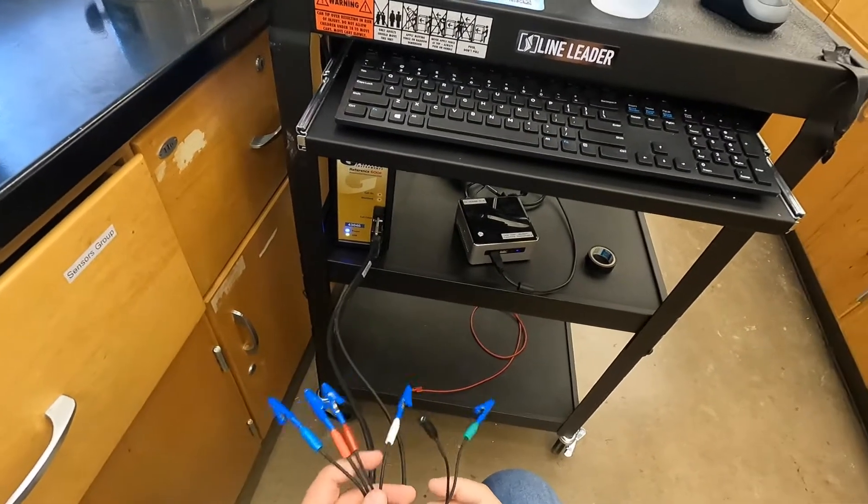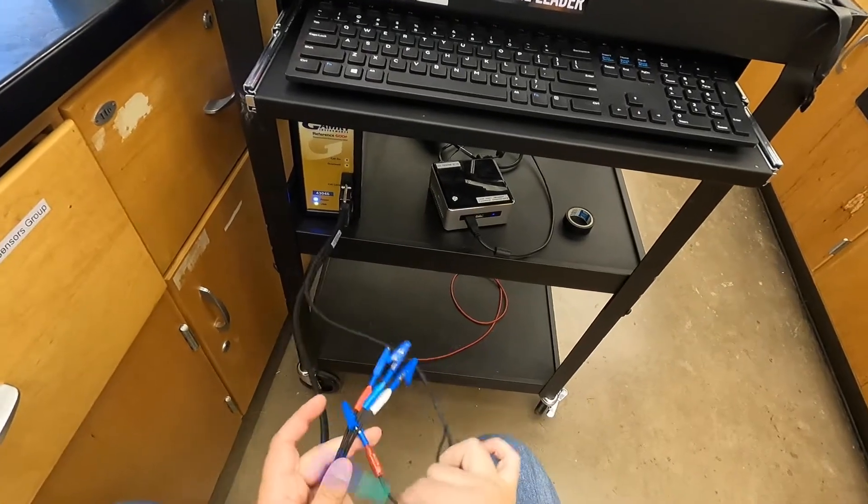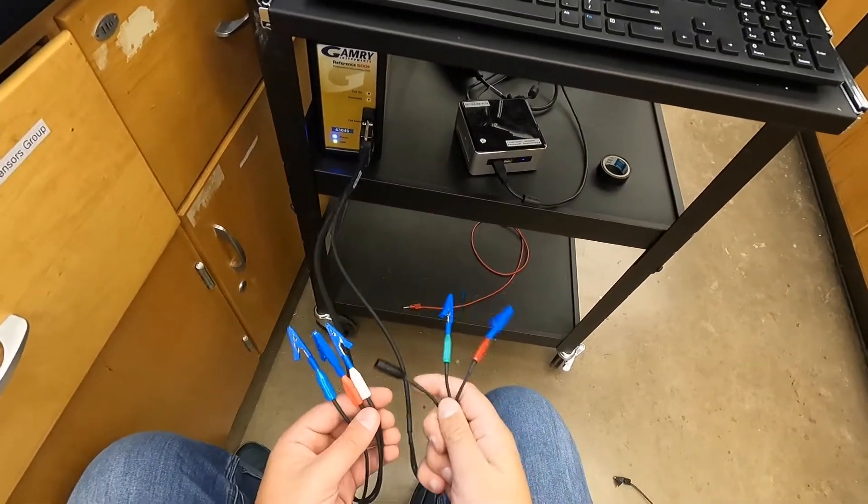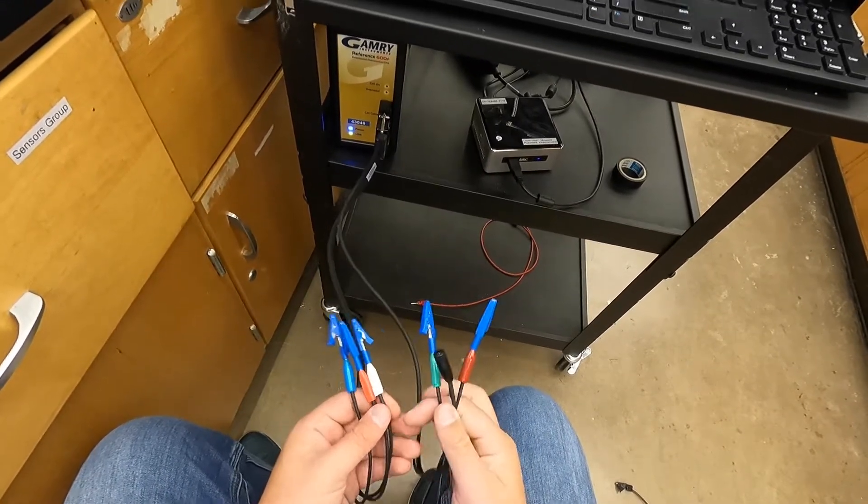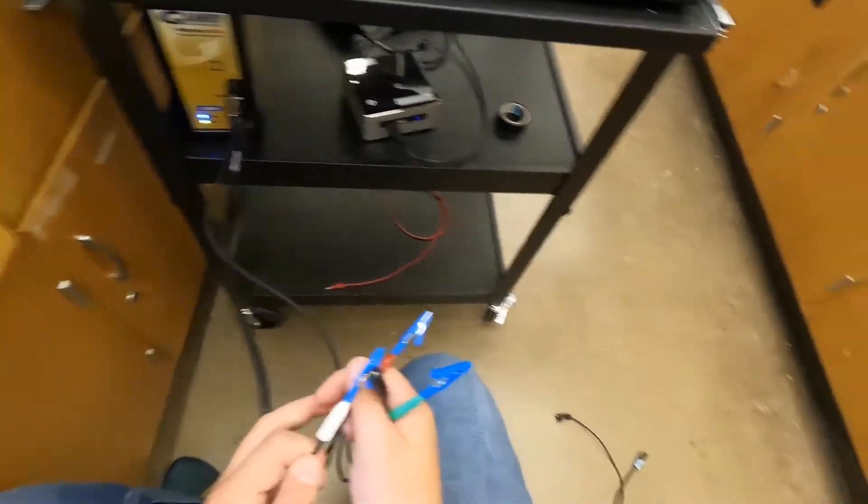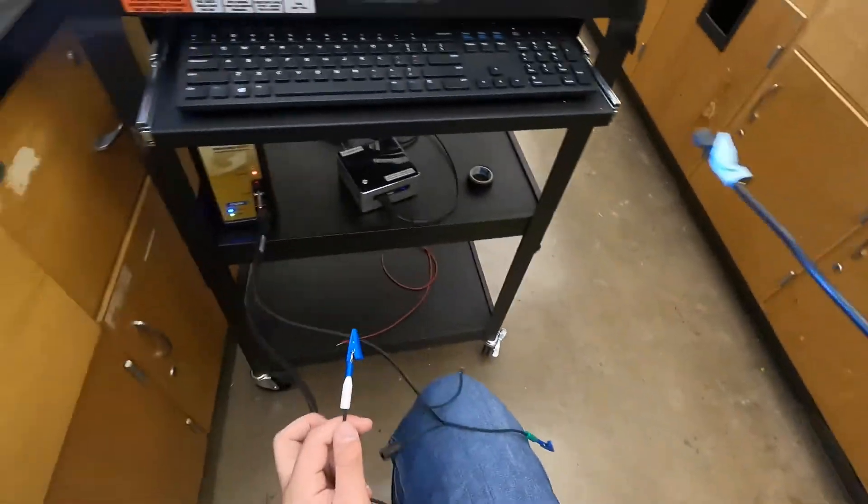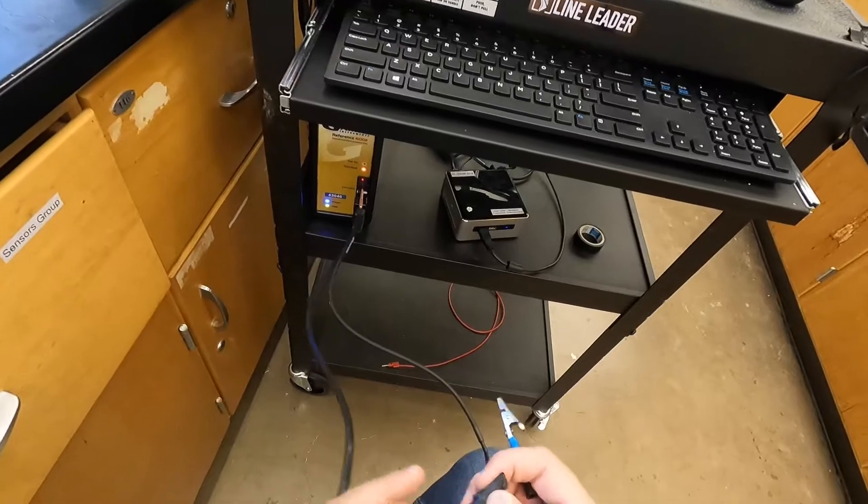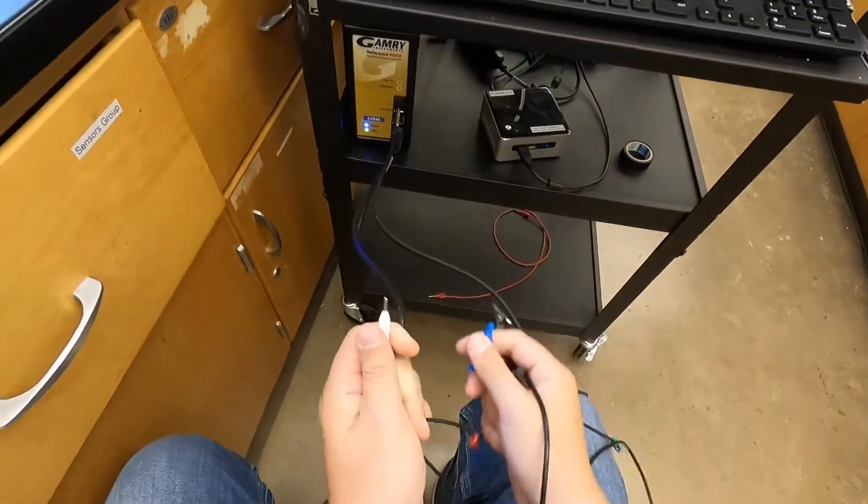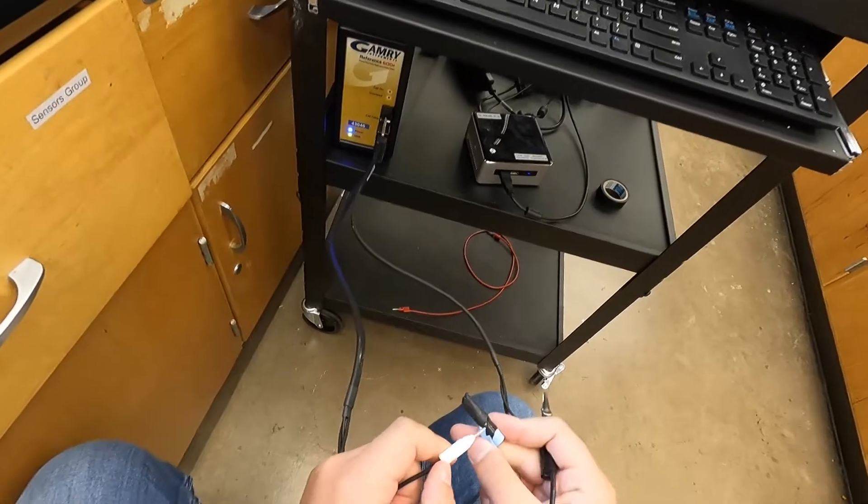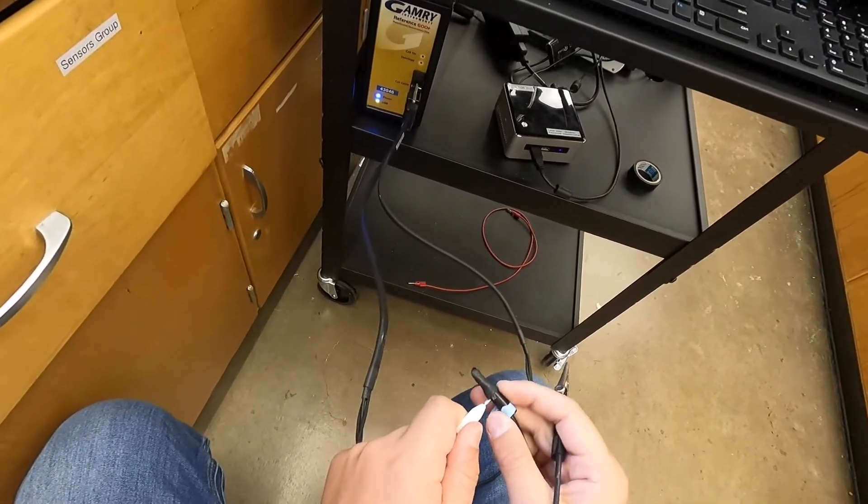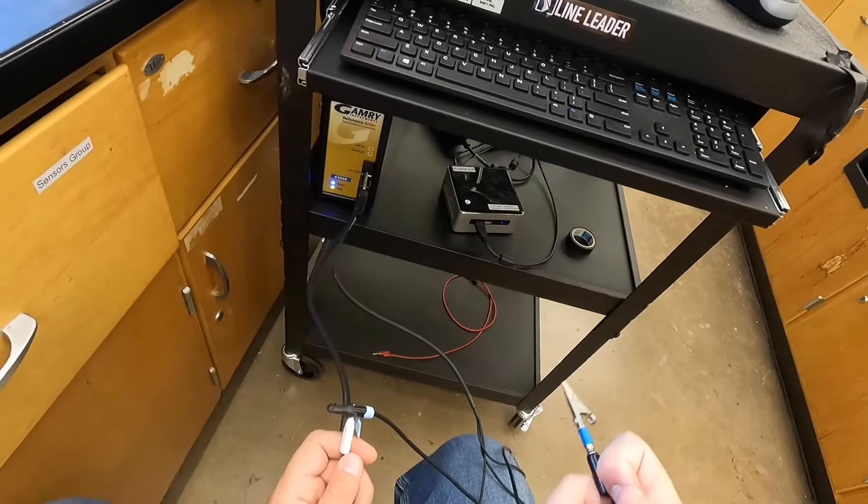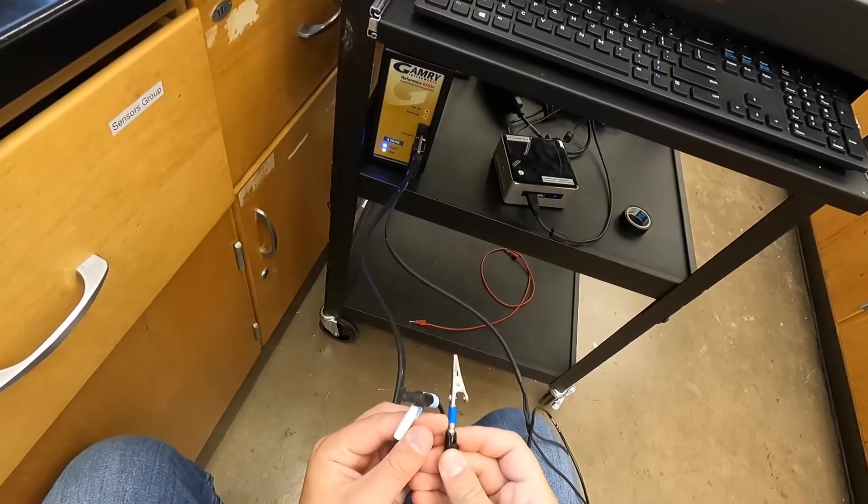In the meantime, here are all of your electrodes. To start, we're going to plug in the reference electrode to a longer lead so that you can connect it to a cell. We have a cord set aside for this that's labeled reference. It's also got a blue heat shrink coating on the alligator clip. Take off the Gamry alligator clip to expose the mini banana connector there and just plug that into the end of the cable and set that aside.